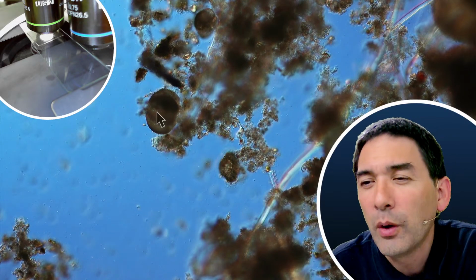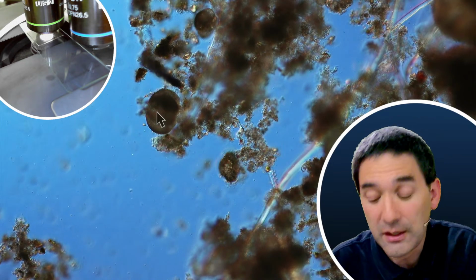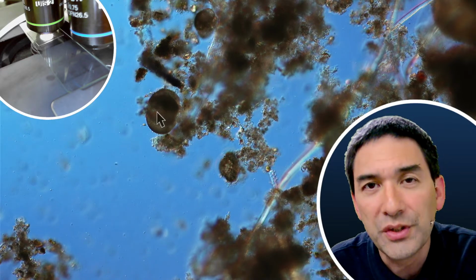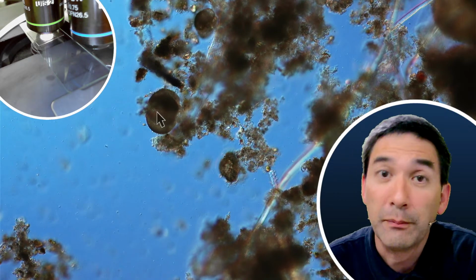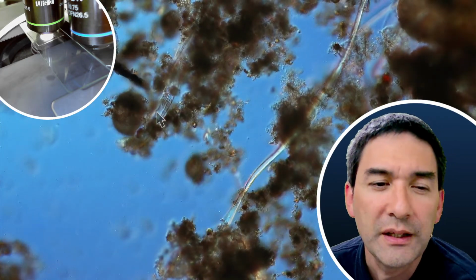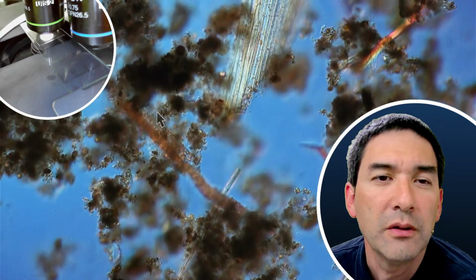Where are the microplastics? Well, I don't know if I'm able to find one here, but every now and then you do find synthetic textile fibers, and you notice that they're synthetic because they sometimes have a color which is different, blue for example, which you otherwise don't find very commonly in the environment. And then you know that they must have come from somewhere. I've not seen so many here right now.